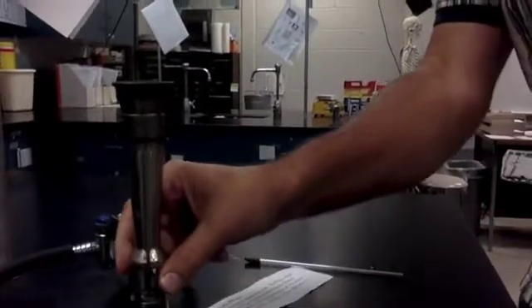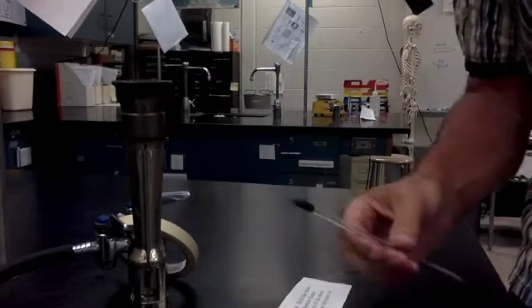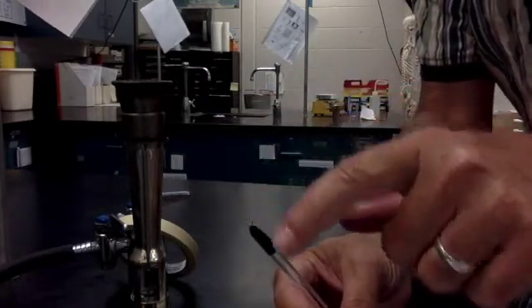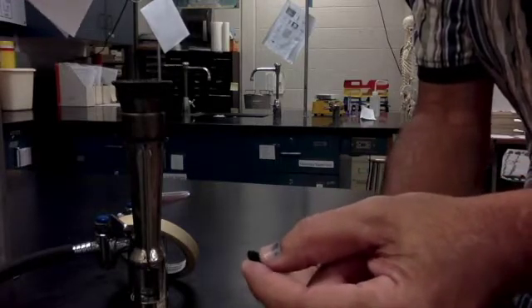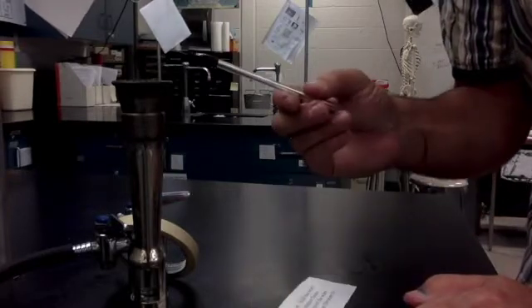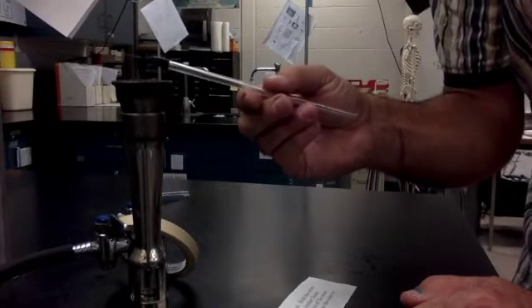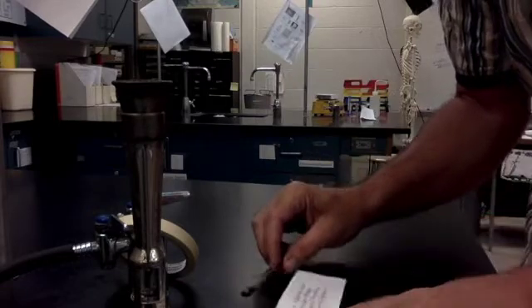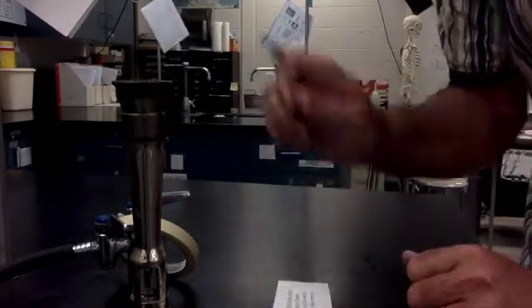So station 6, we have another one putting a metal in a fire. This is your platinum wire here, and with some rubber tape here, we have taped it onto the end of a glass rod, and you're going to put that in the flame. My only caution here is don't put it too deep in the flame or you'll be lighting the rubber tape on fire. But you want to look at the appearance of the platinum wire when it gets hot in the flame.